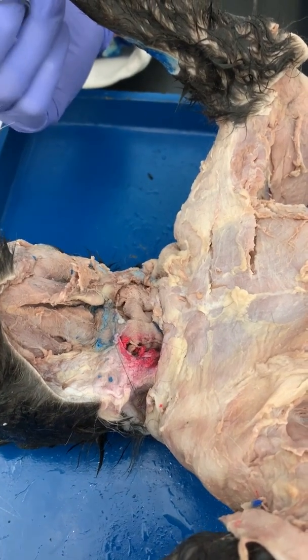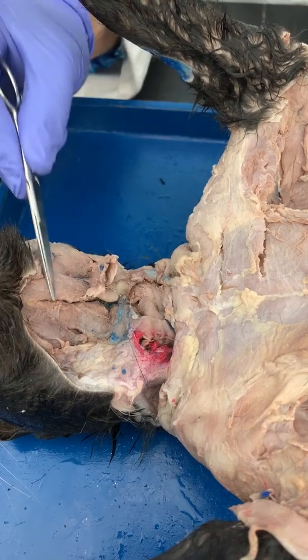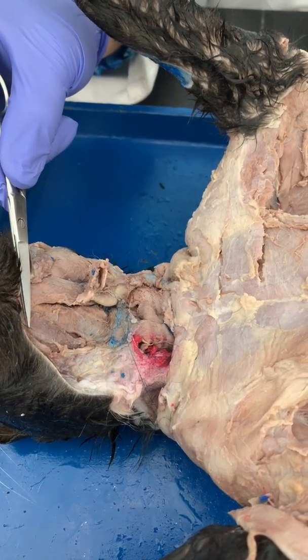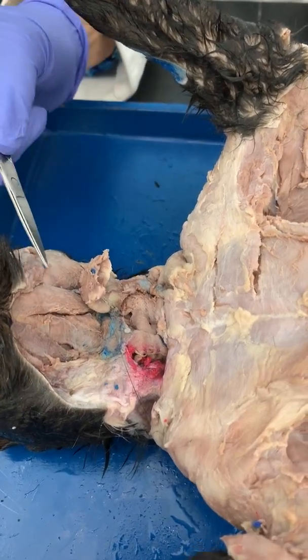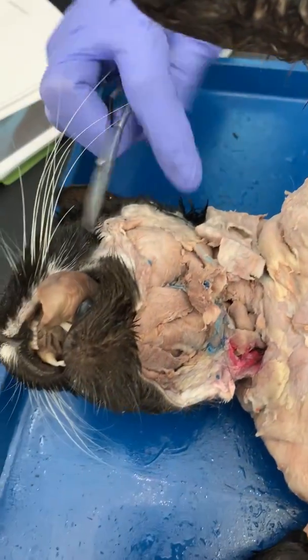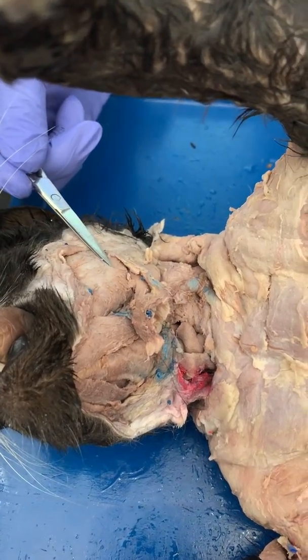With the muscles of the neck and head region. So we're going to begin with the digastric muscles, this one right here and that one. Deep to that is the mylohyoid on the side, right? You have to retract all this connective tissue. That is your masseter. You can see it looks like a cheek.